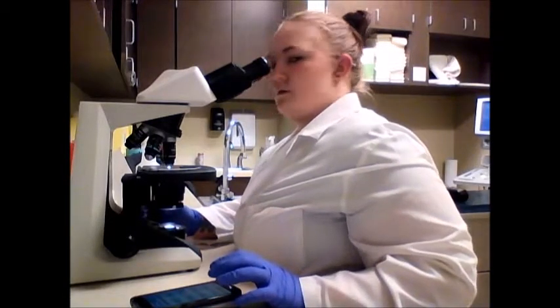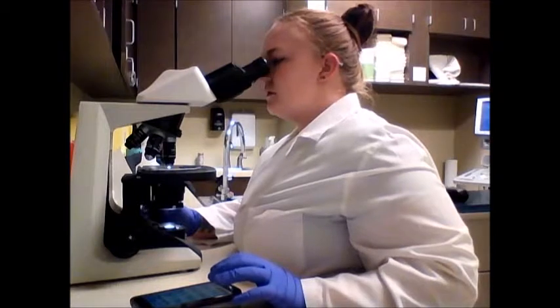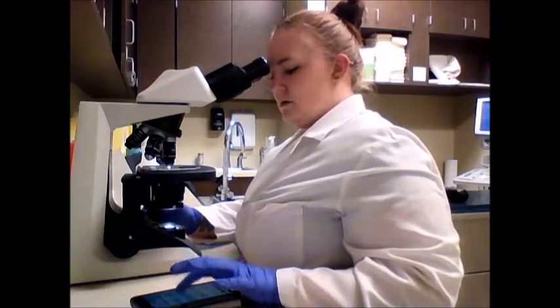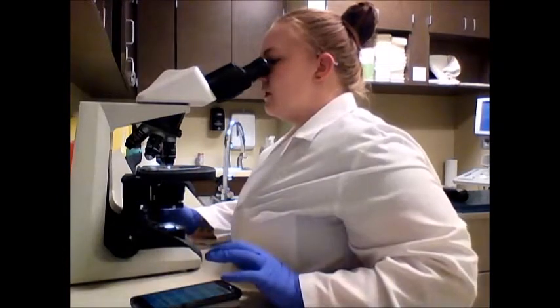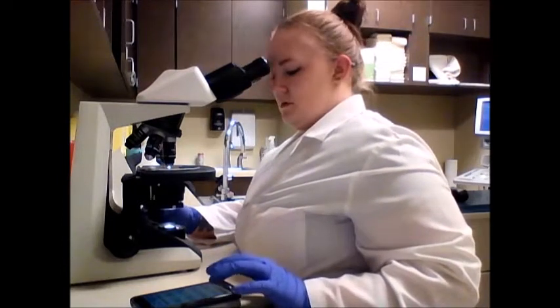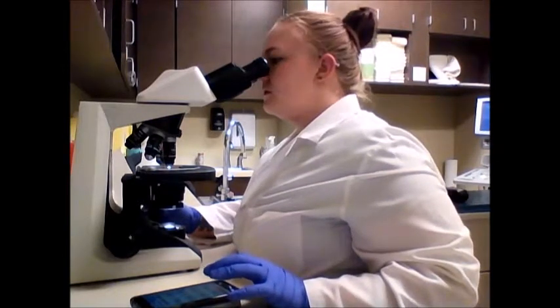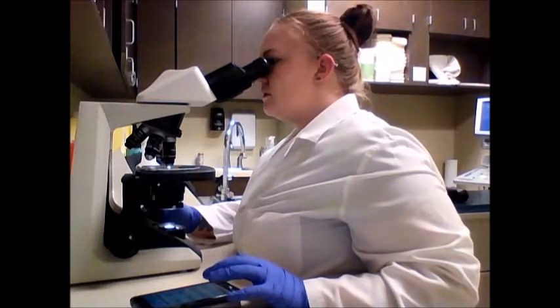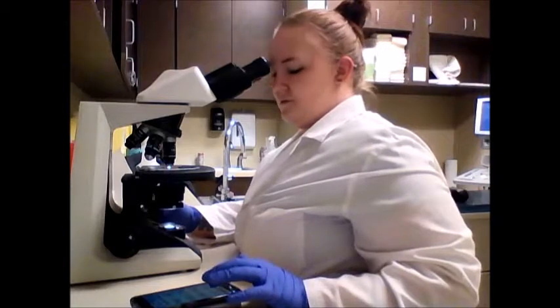Lymphocyte, neutrophil, neutrophil, lymphocyte, another platelet clump, lymphocyte, neutrophil, neutrophil, neutrophil, neutrophil.